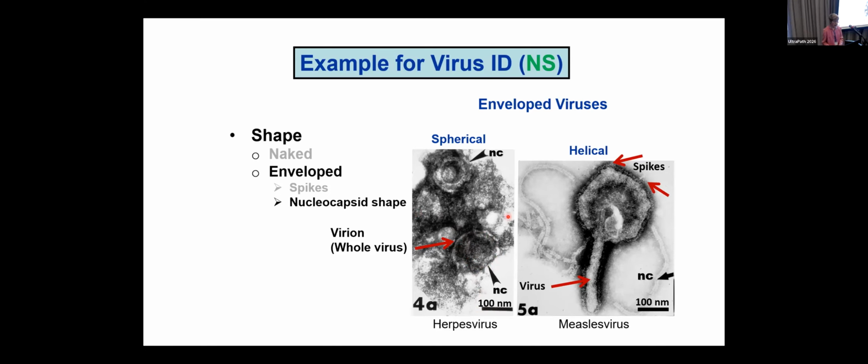On the right-hand side, we have a nucleocapsid that is, again, proteins holding together the nucleic acid, which may be RNA or DNA, but not both in a specific kind of virus. And this is like a slinky or a coiled phone cord. So it is coiled up inside the whole virus, and you can just begin to see a few right here. This particle also has spikes around the outside.